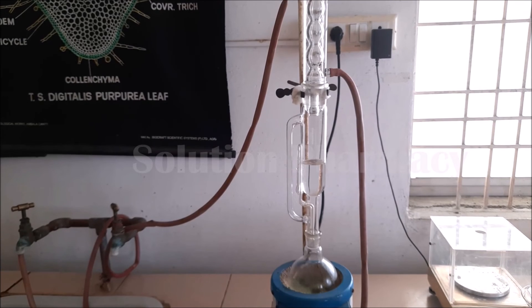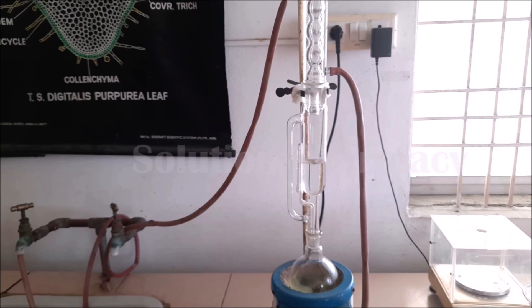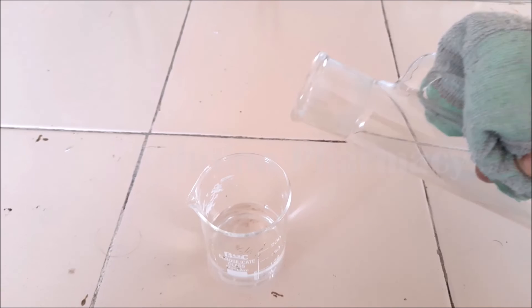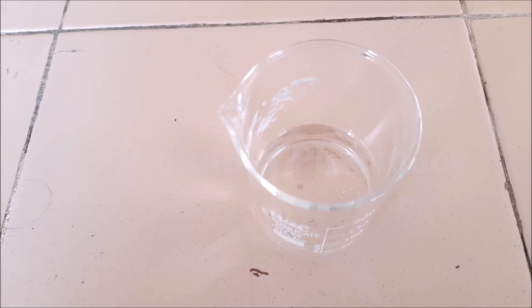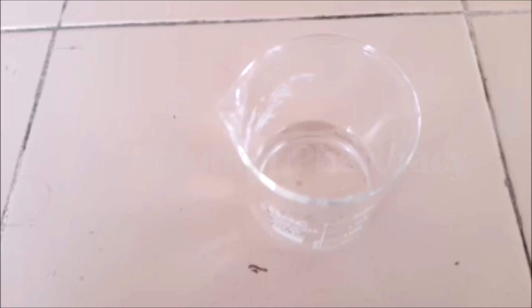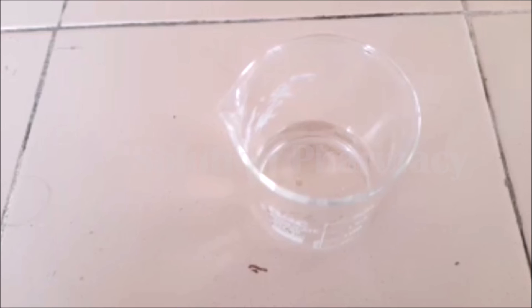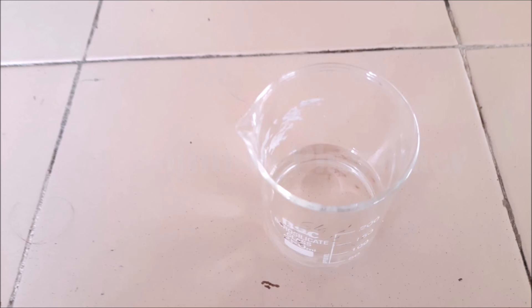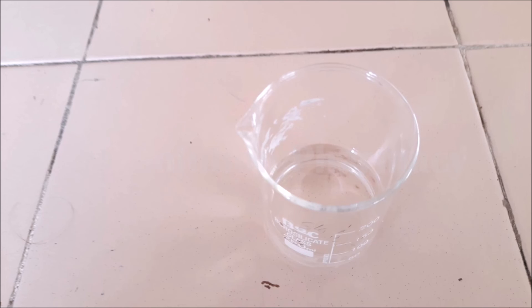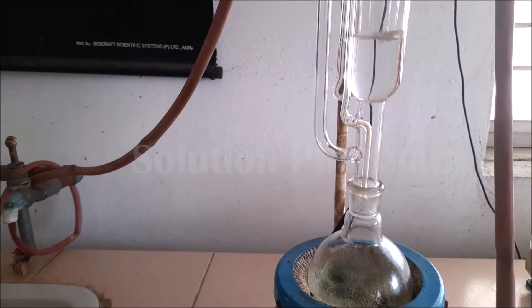When the solvent level reaches just below the tip of the siphon tube, turn off the heating mantle and allow the Soxhlet extractor to cool down. Then transfer the recovered solvent into a container. Here we are immediately transferring the recovered solvent into a beaker, which is why we have used a cotton cloth to handle the hot extractor. This is the recovered solvent — the same solvent used for the extraction at the start, now collected back using the same Soxhlet assembly. The liquid extract has become concentrated because solvent was removed from it. If the extract is still diluted after the first recovery, set the round-bottom flask back in the assembly and recover the solvent again with the same process until a concentrated extract is obtained.